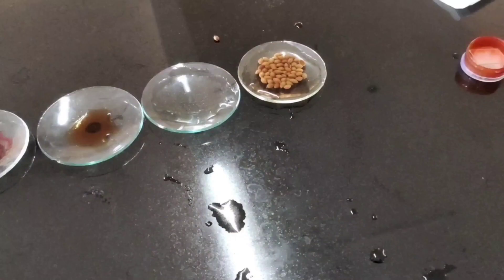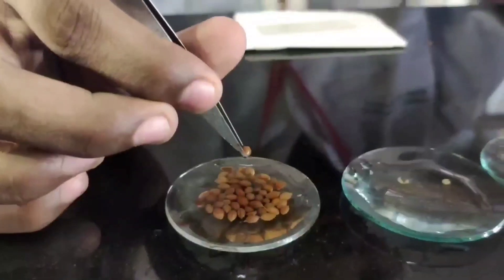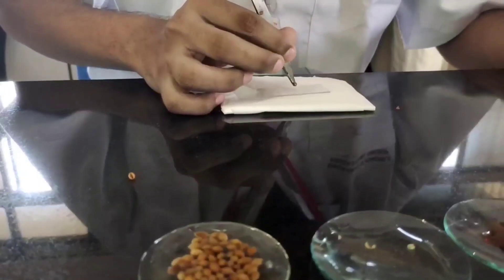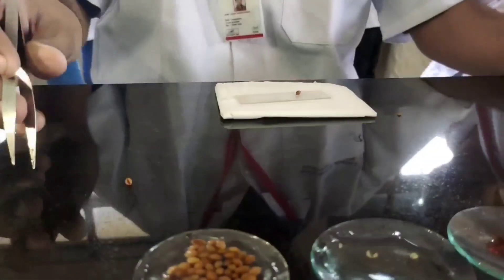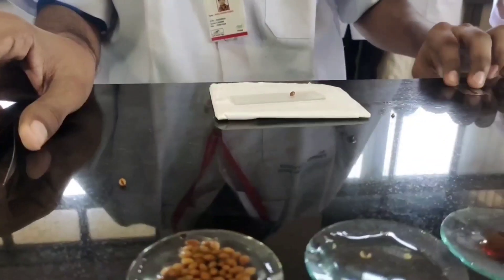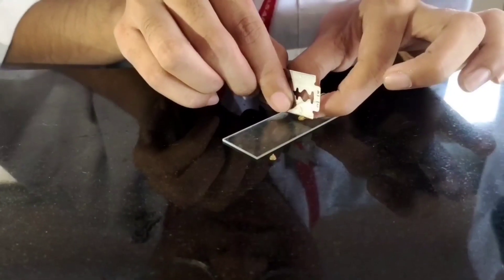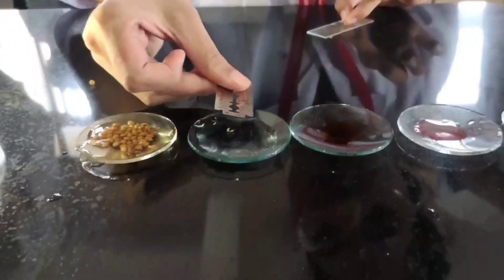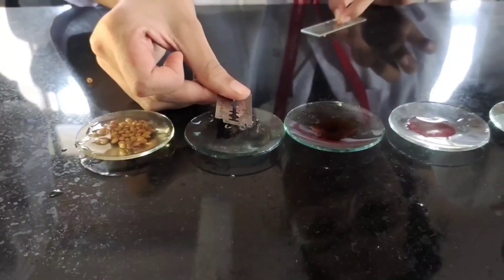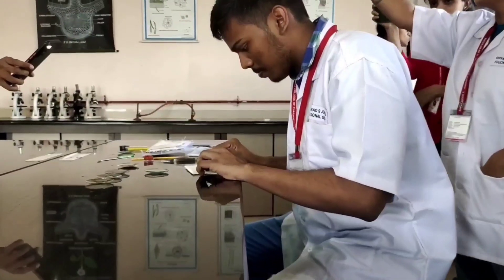Now we will start with the transverse section of the coriander. We will select a soft coriander seed and take a number of sections of that particular seed. Then transfer that section into the watch glass containing plain water. Repeat this same procedure for each and every seed.